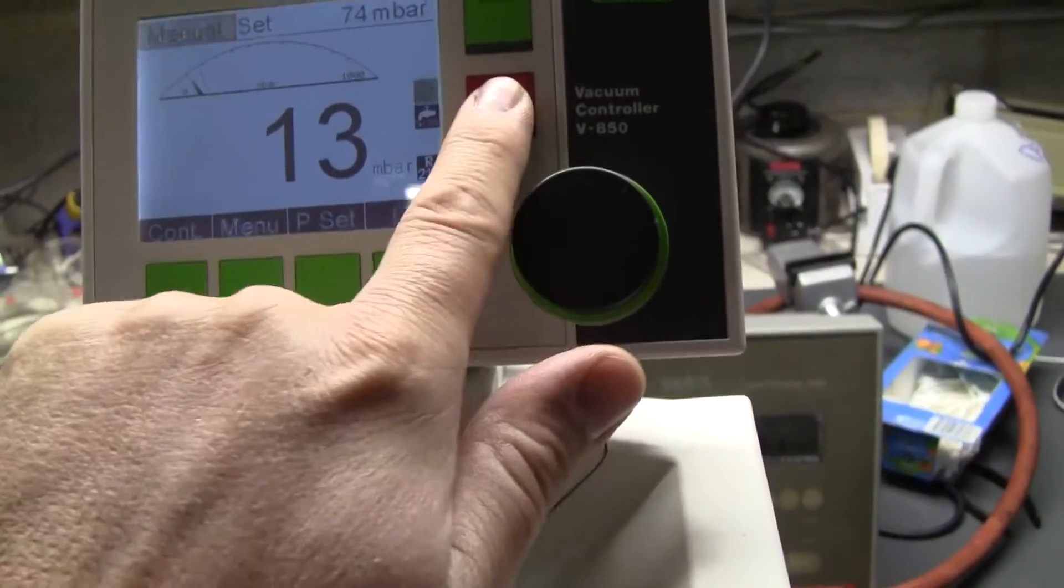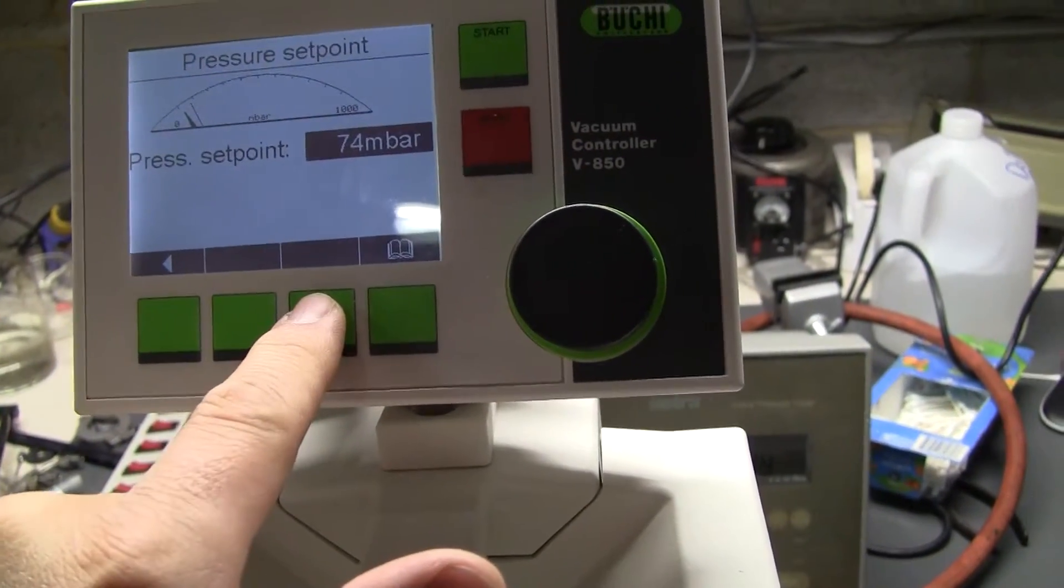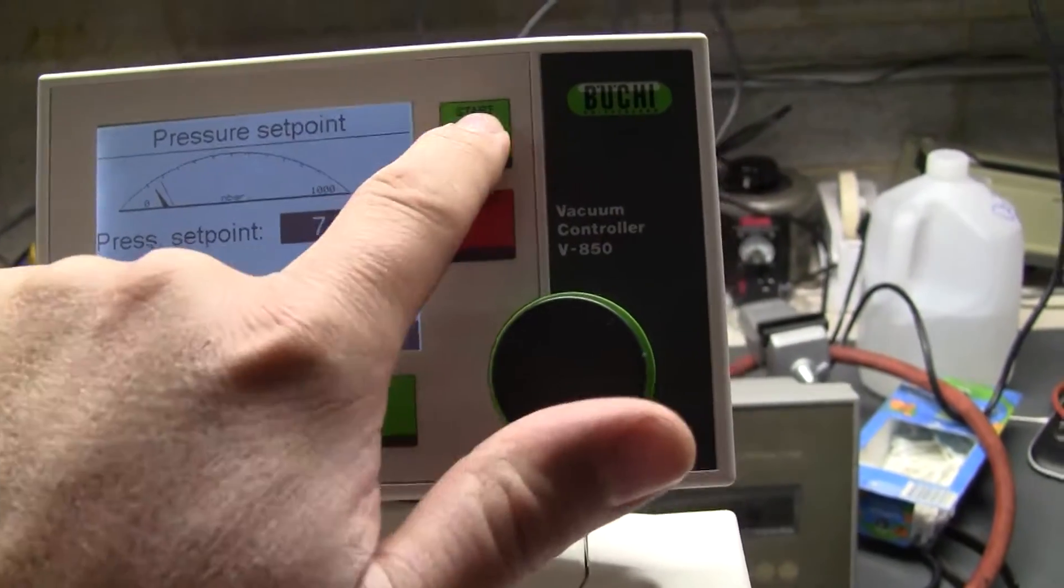We're going to hit stop. I'm going to set it to the pressure set point. Hit start.